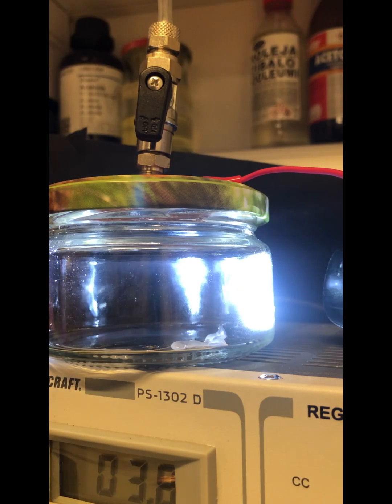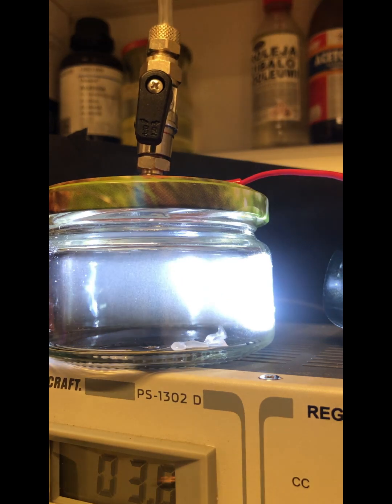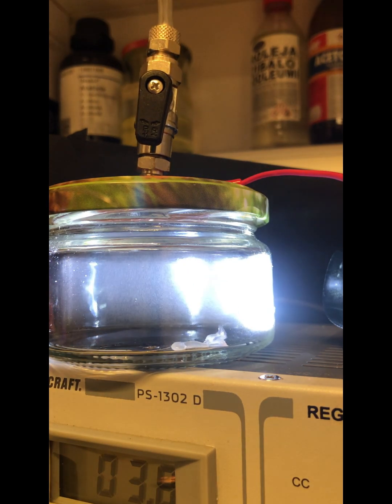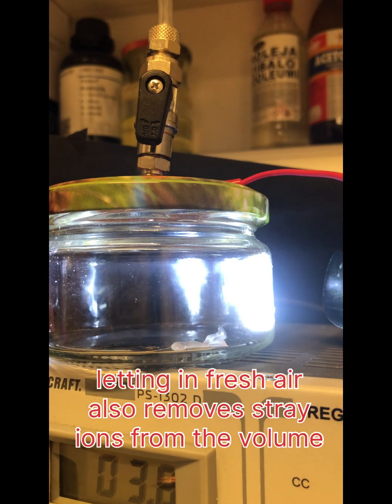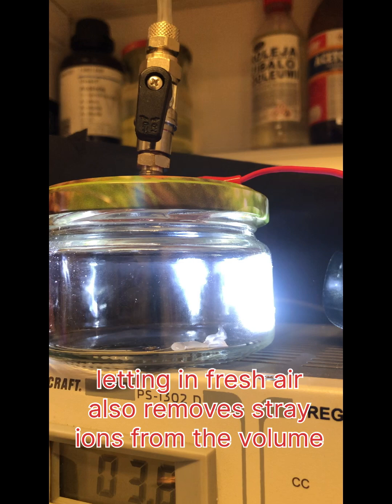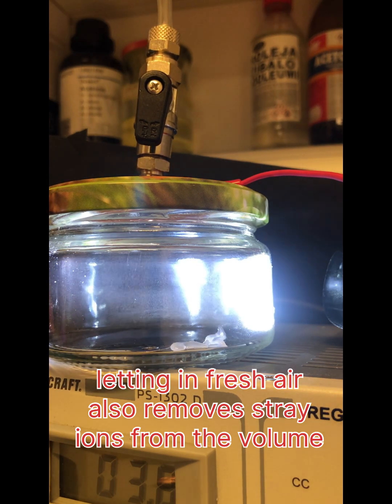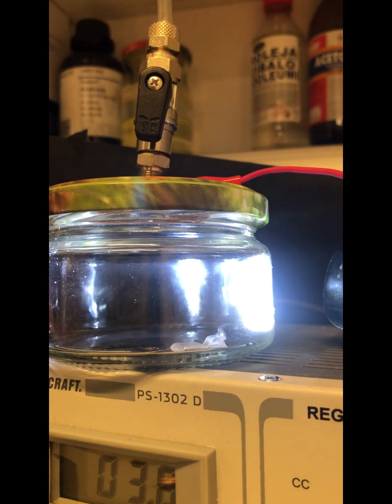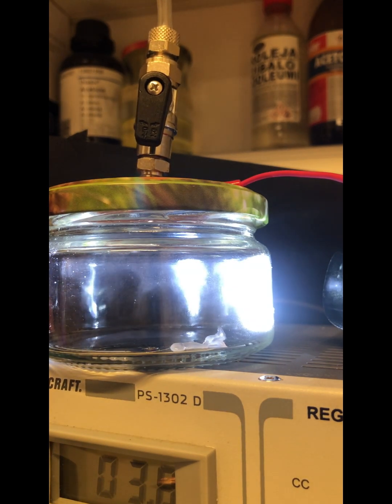When there is too much vapor, then there is too much fog and no tracks. I need to find the optimal vapor concentration. It could be too much, so I let air in. Good. Yeah, very good tracks. Very good.